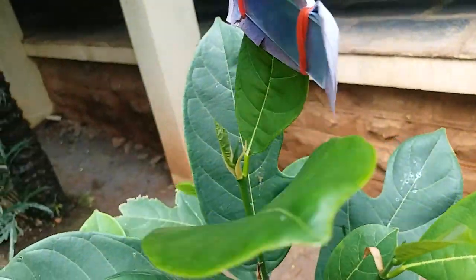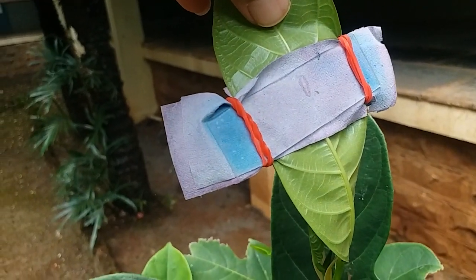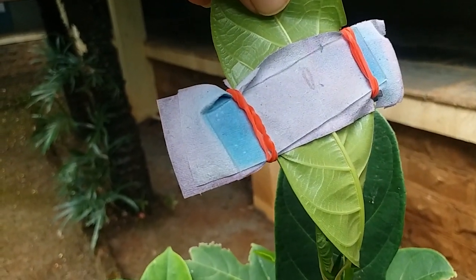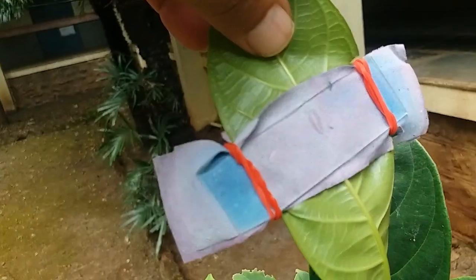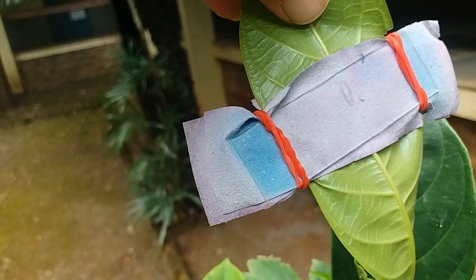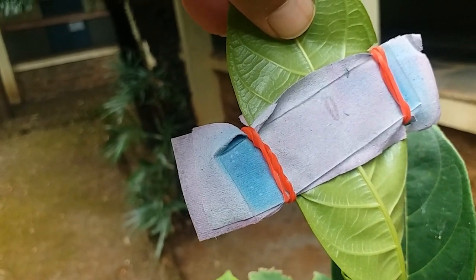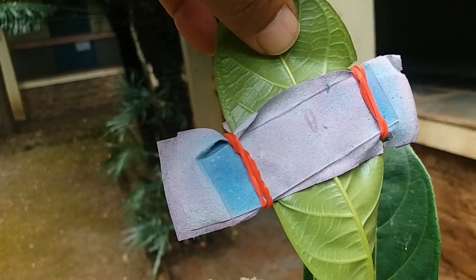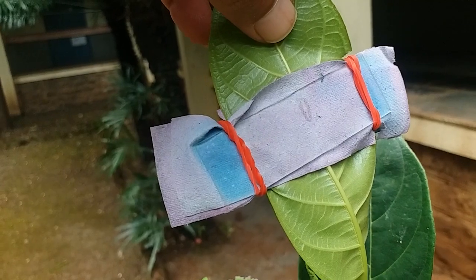On the lower epidermis, the paper covered by the slide turned completely pink. The paper present outside the leaf margin remained blue, because there is no water or moisture there. But the paper on the lower epidermis covered by the slide turned pink due to the higher rate of transpiration.